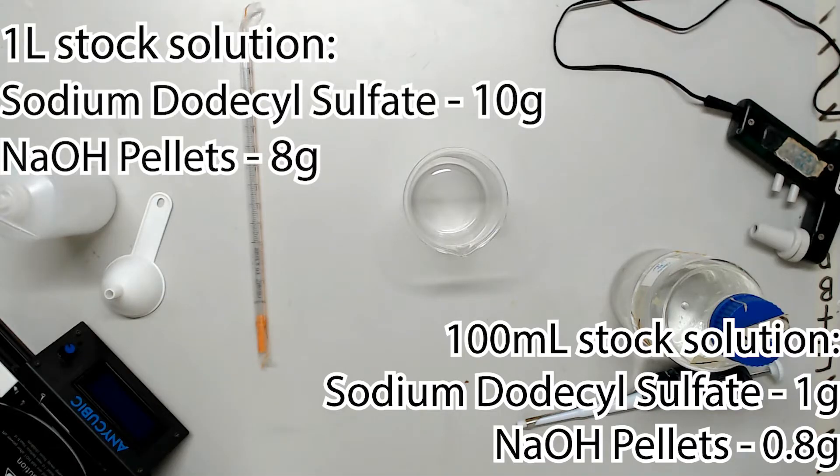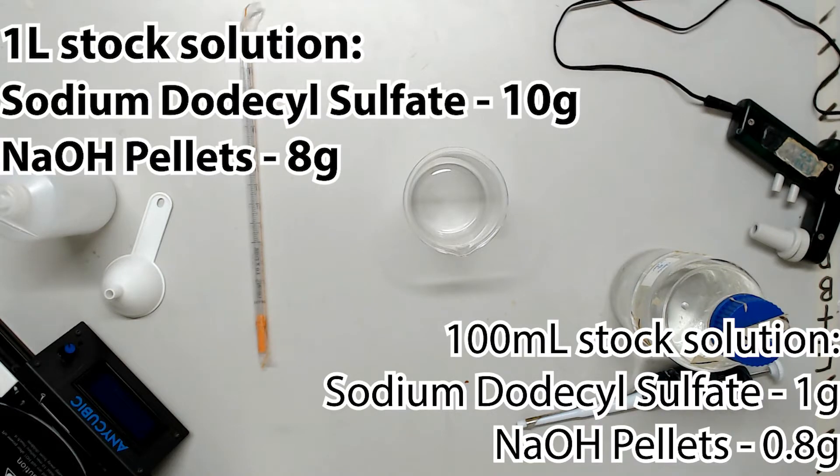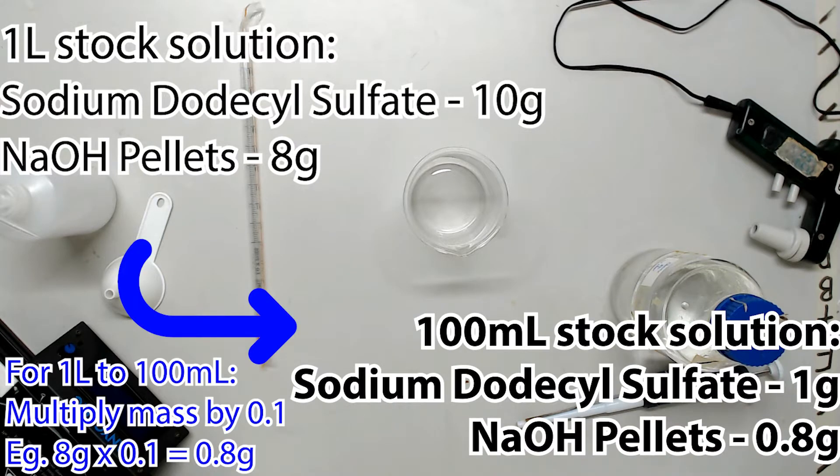Time for the main act. As before, the amount of stock solution your lab needs is going to depend upon your volume of work, so we'll show you the quantities for a one liter solution on the screen with a conversion calculation to get to the 100 mil quantities I will now describe for the visual demonstration.